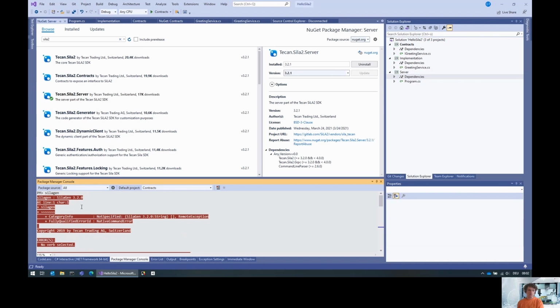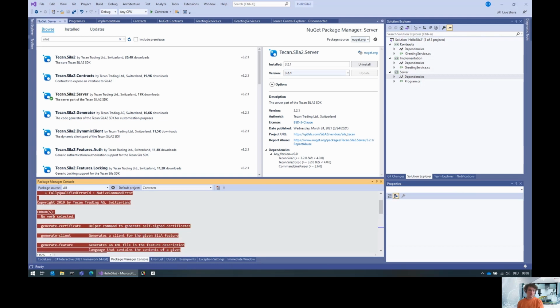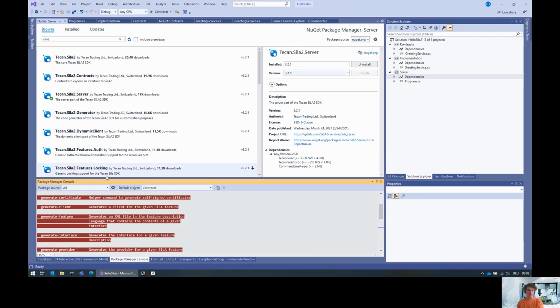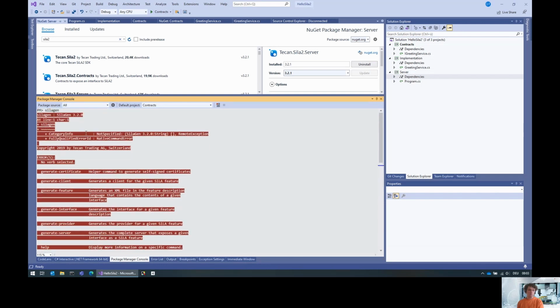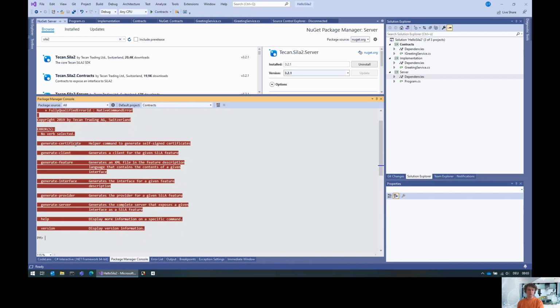It told me here that I didn't select the verb, so I was using that wrongly, and then it tells me what the possible verbs are that I can use to execute this tool. There's a verb to generate certificates, a topic that I will address in a later video. There are verbs to generate clients, to generate features, to generate providers, to generate interfaces from a given feature. And there's an all-in-one solution to generate complete server code. We are going to use that. So let's first explore the parameters.